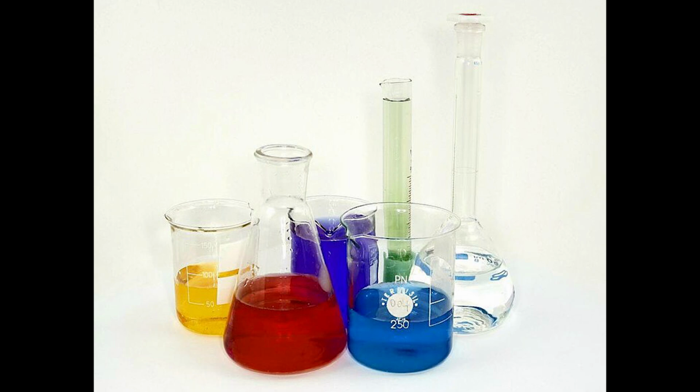Okay, so we've already gone through a bunch of different steps and a lot of problems, but what happens now? Well, now is a bit relative because all of this, every single step we've done so far, was just made so that we get ions going past this specific point. And so now that we know when and which are going through it, all of this was basically the equivalent of washing glassware before the actual experiment. And now it's time for us to fire a laser at them.